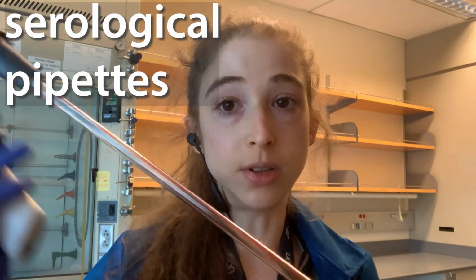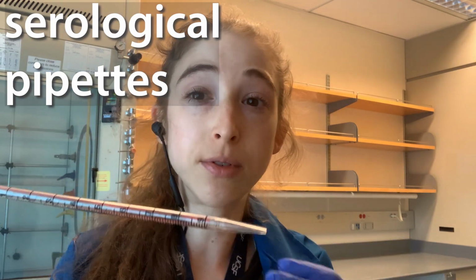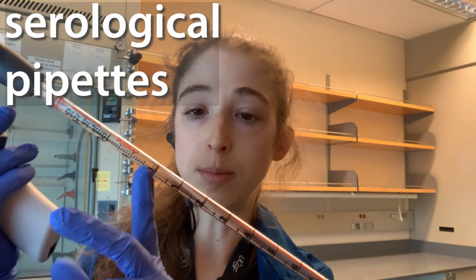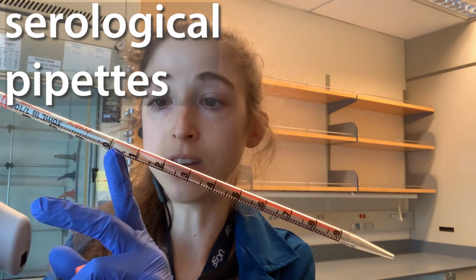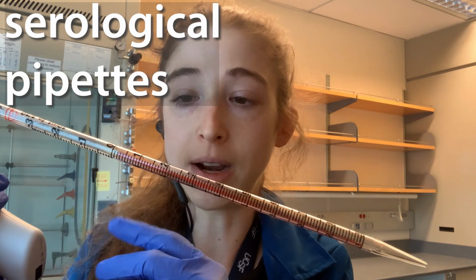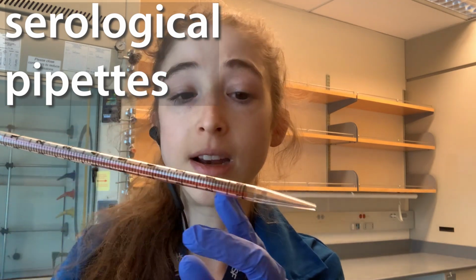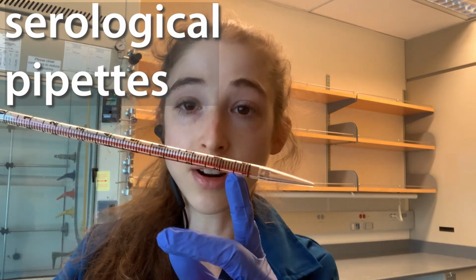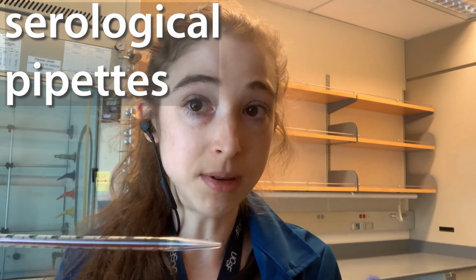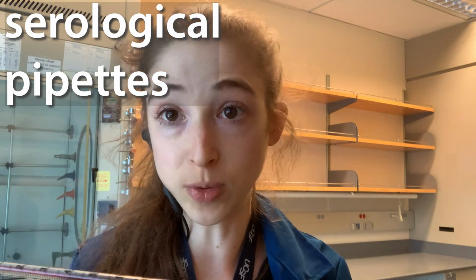We also don't want bubbles when using a serological pipette. Although we need to blow out in order to get the total volume, if we're really worried about introducing bubbles, we can calculate. Say I want to pipette 9 milliliters, I could go to the 10 milliliter line, but then only dispense out to here and avoid having to do the blowout, and avoid the bubbles that way. This can be good if you're doing cell culture work where the cells are really sensitive and you don't want to introduce bubbles.